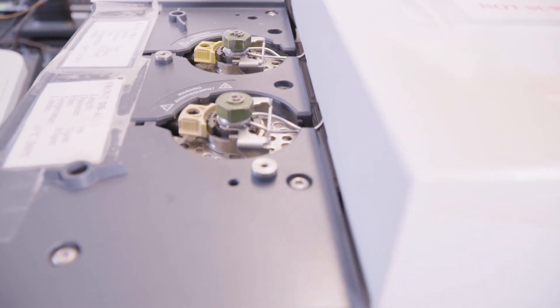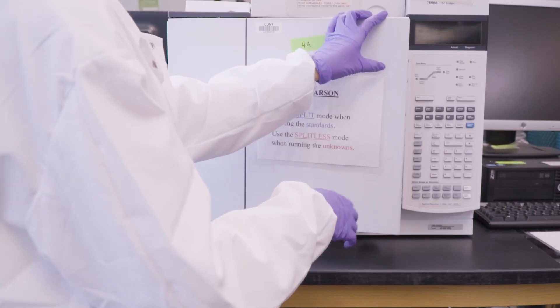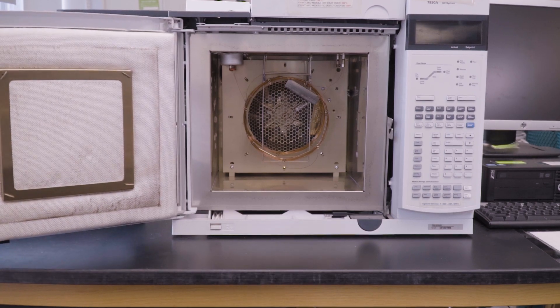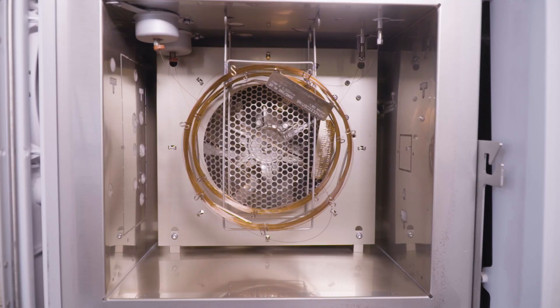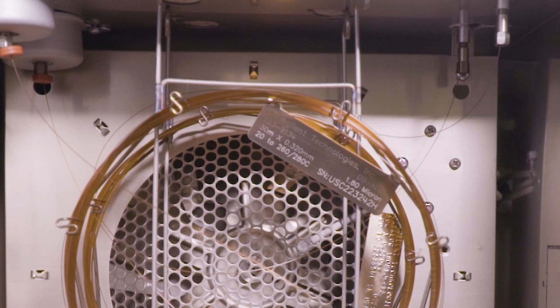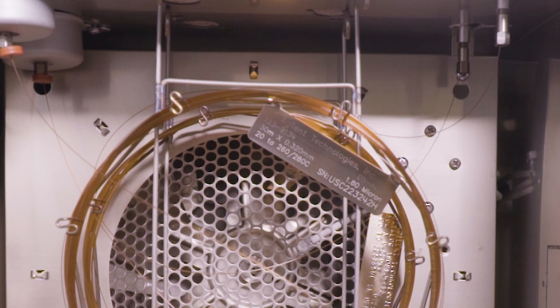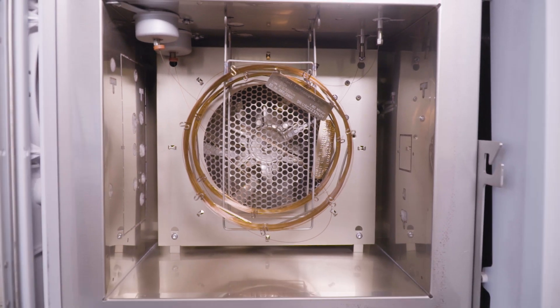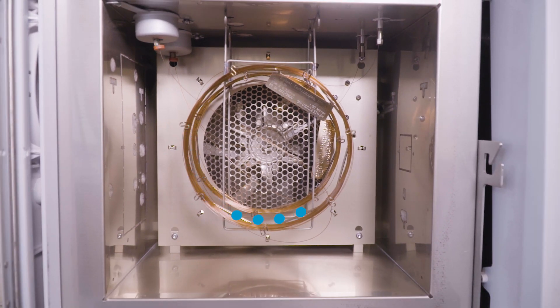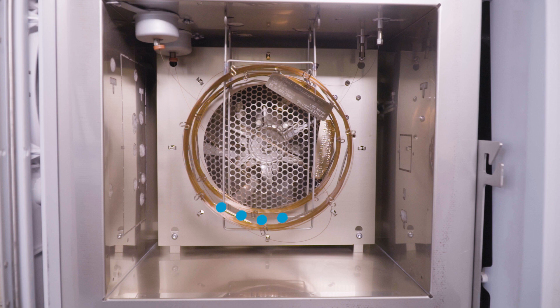The injector is linked to a capillary column, which is housed inside an oven. This oven plays a crucial role, as it precisely controls the temperature during analysis. On the column, you'll find essential information like its length, its diameter, and the type of stationary phase used. As the analytes travel through the capillary column, they undergo separation based on their affinity between the mobile phase, the carrier gas, and the stationary phase.